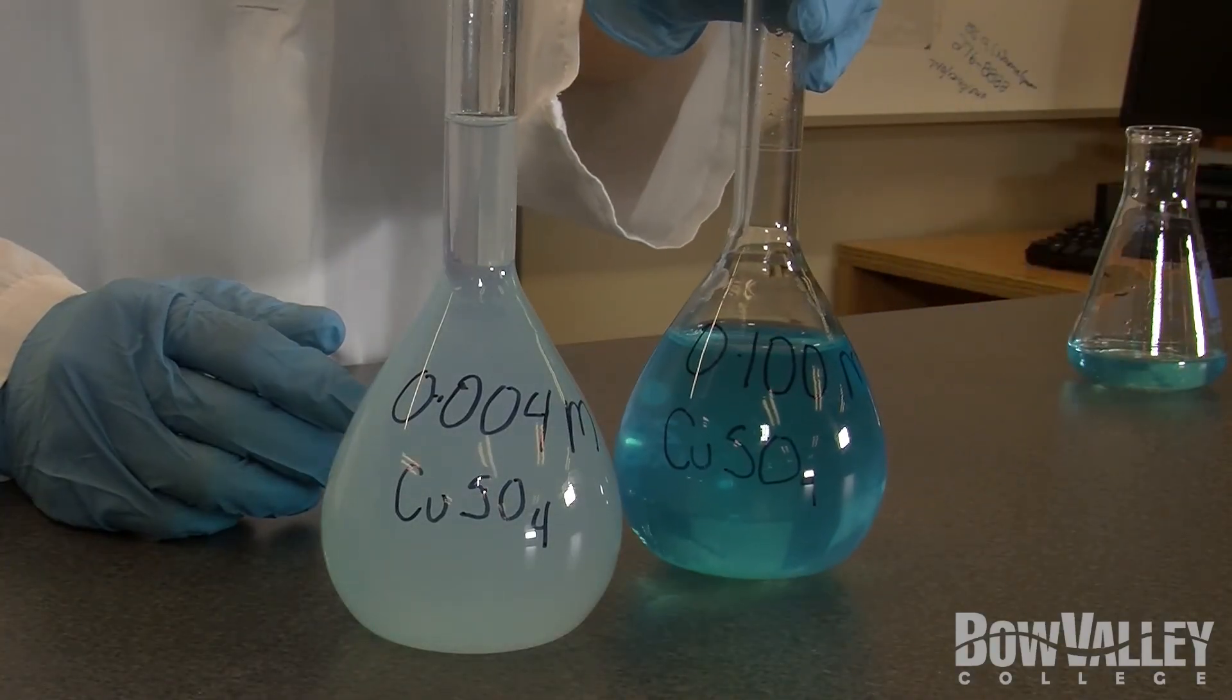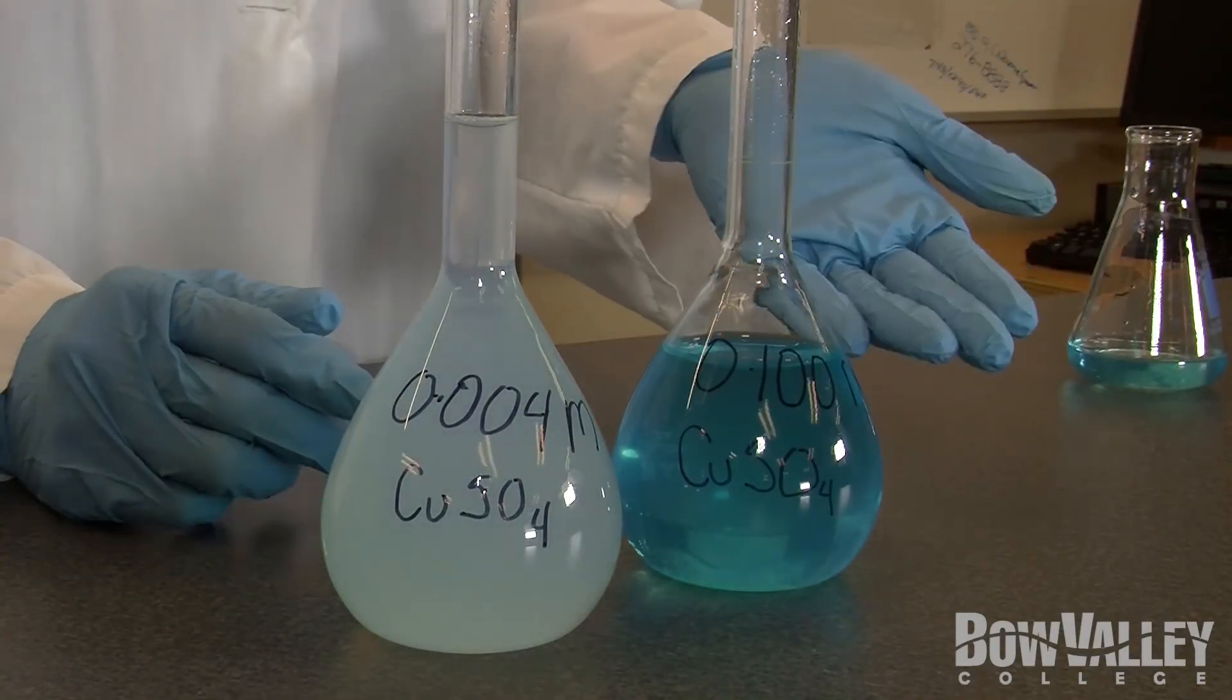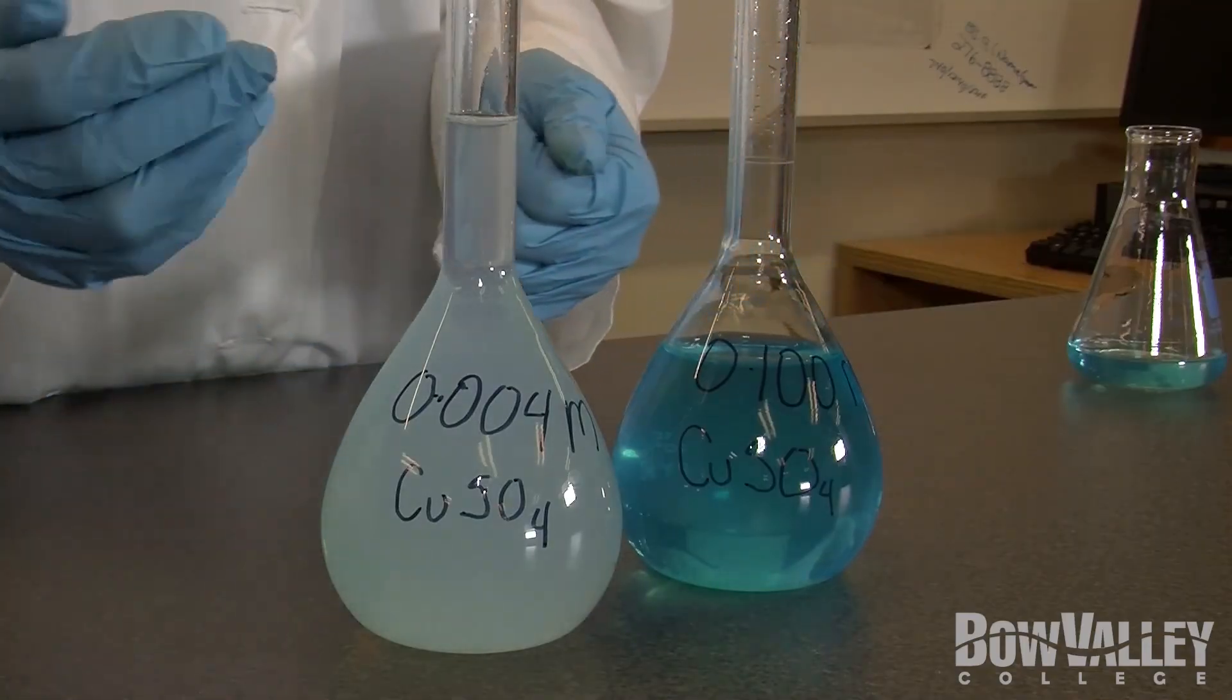You have now learned how to weigh a compound, prepare a concentrated stock solution and prepare a diluted solution. Now if you look at them side by side, you can see that the stock solution is darker than the diluted solution.